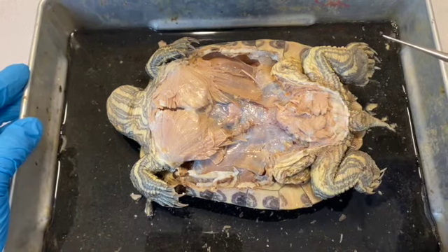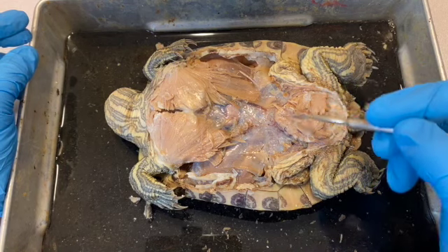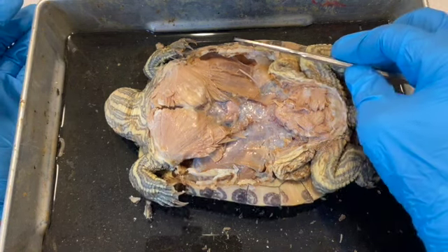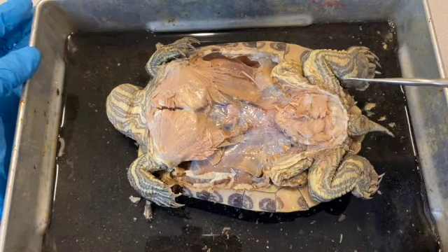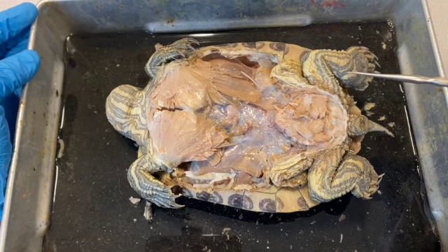in terms of musculature. Now, for most animals, we use larger abdominal muscles to hold the contents of the abdominal cavity in place, but these animals don't really need that because the plastron covers this area and provides very good support to the abdominal cavity inside. So what I'm going to do next is I'm going to remove these muscles, I'm going to open up the abdominal cavity, and we'll start taking a look at the structures that are in there.